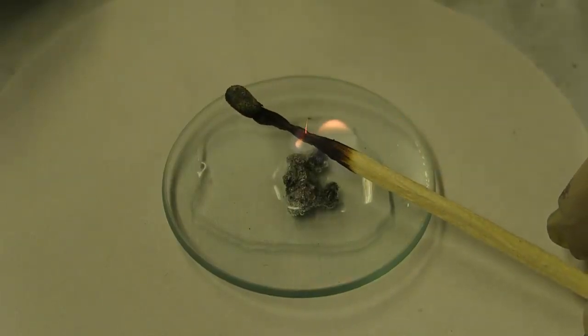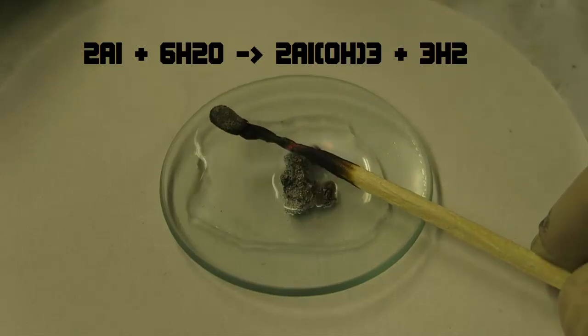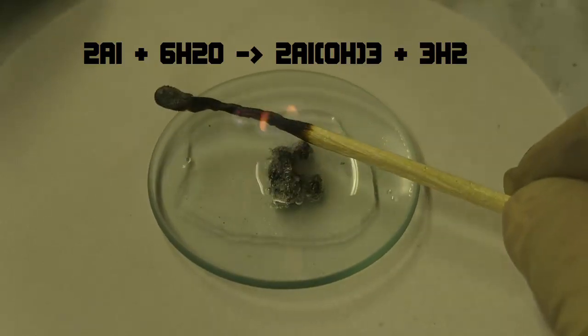The cool side effect is that the gallium alloy is actually not reacting and can, when larger amounts are used, be recycled.